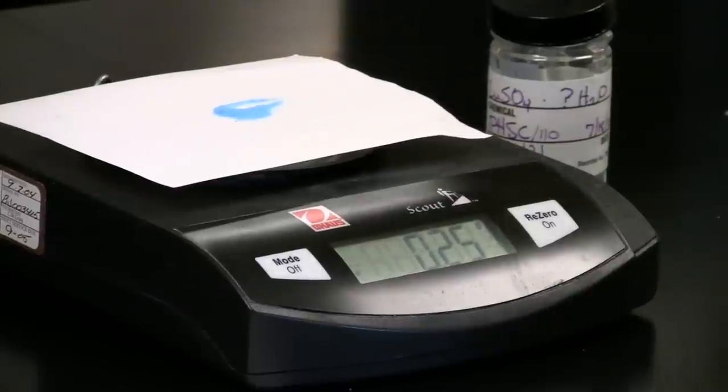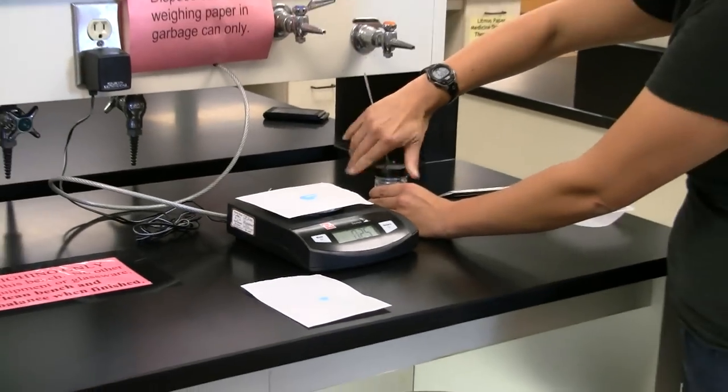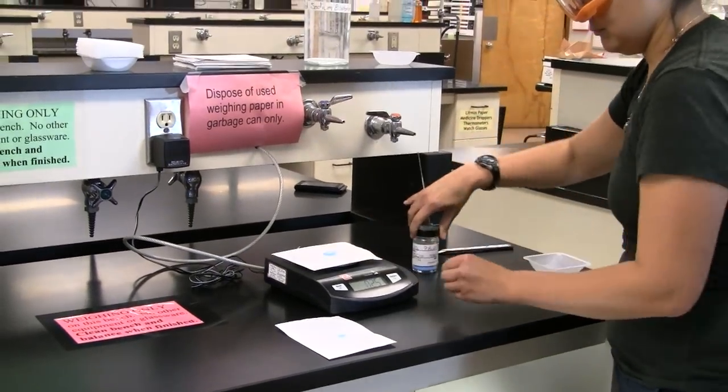When you are done, close any containers and return them to the prep bench. Make sure that you clean the balance.